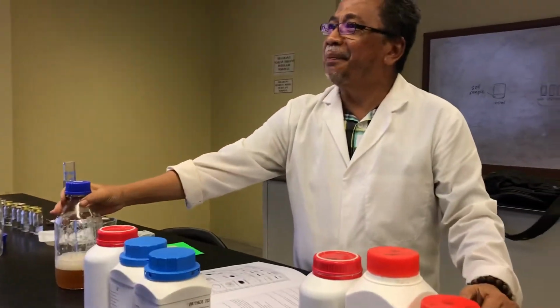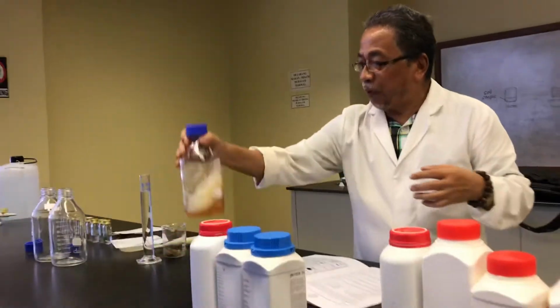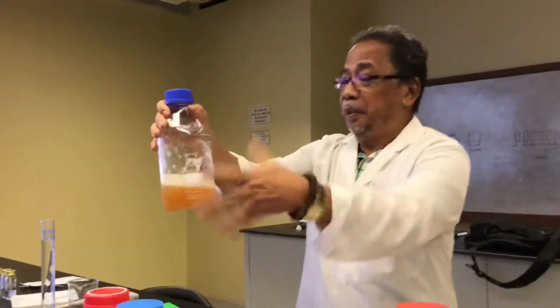They ask for one basket. Okay, we don't have to. When you autoclave, it will all be homogeneous for this thing. So that is the simple medium. So we go to the next one.